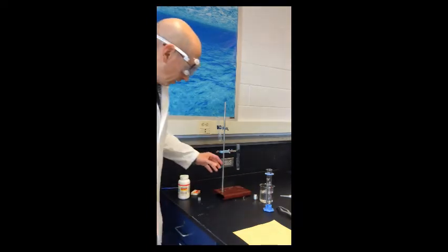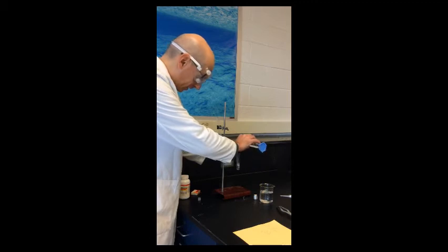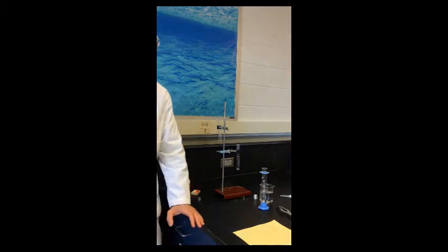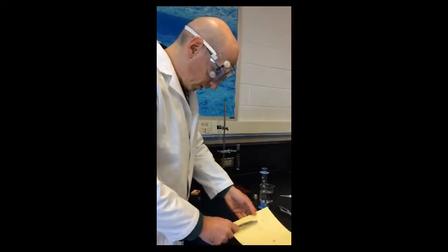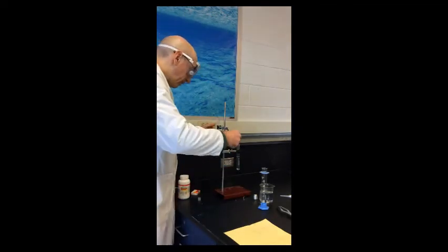Now what we're going to do here is do basically the same thing. I'm going to set it up this way. I'm going to put some water in this test tube, and then I'm going to go ahead and put some calcium in, and we're going to see if calcium is reactive with water. And that would be a chemical property of calcium. So I'm just going to go ahead and scoop this up, and then we'll see what tells us if there's a chemical change going on. So I'm just going to drop that in there.